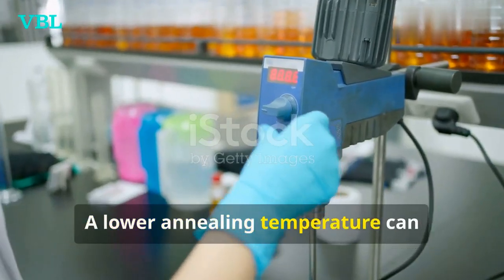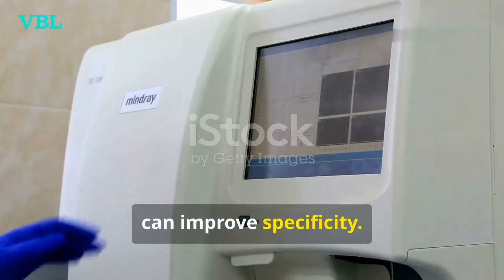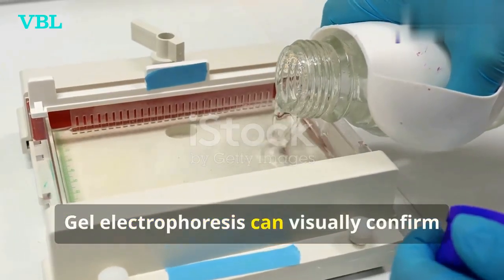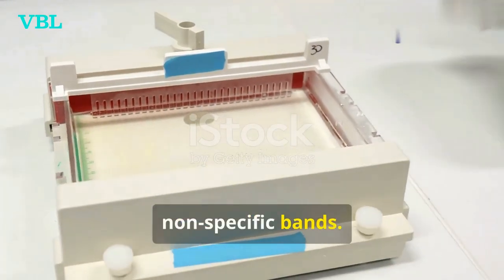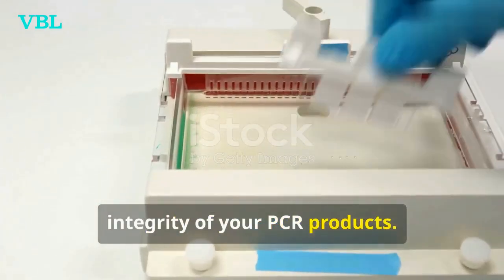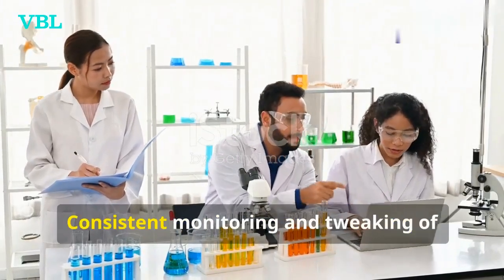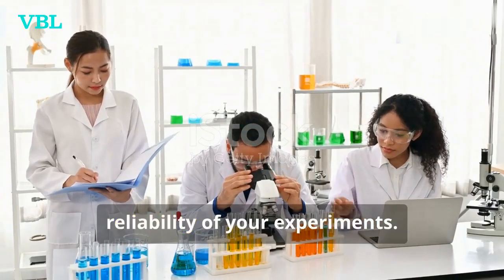A lower annealing temperature can increase primer mispriming. Increasing it can improve specificity. Fine-tuning the temperature settings is essential for reliable results. Gel electrophoresis can visually confirm amplified products and identify non-specific bands. This step is vital for verifying the integrity of your PCR products. Adjusting these parameters can help resolve discrepancies in melt curve results. Consistent monitoring and tweaking of these variables ensure the accuracy and reliability of your experiments.